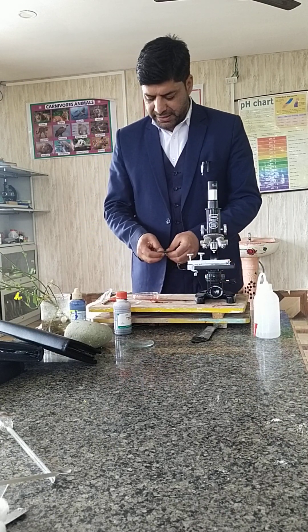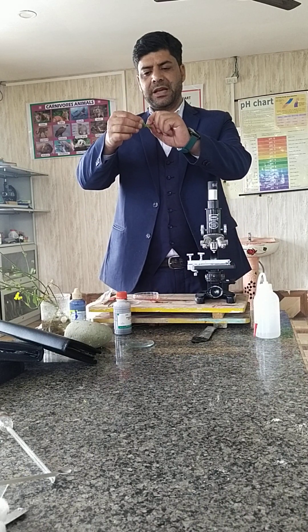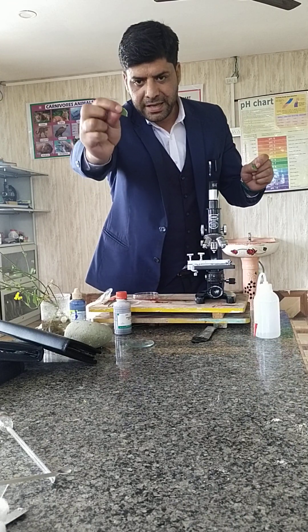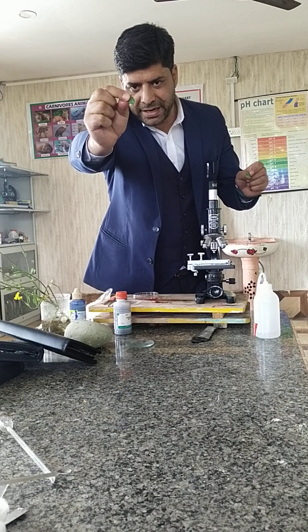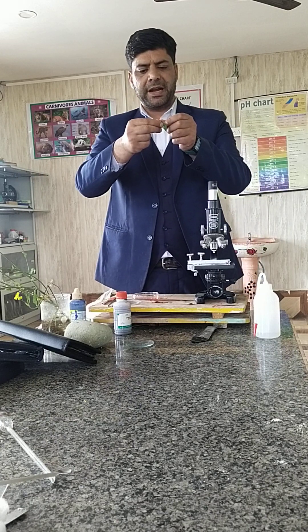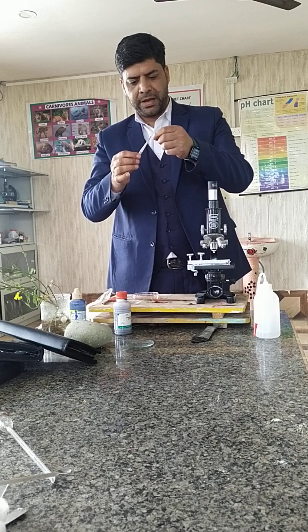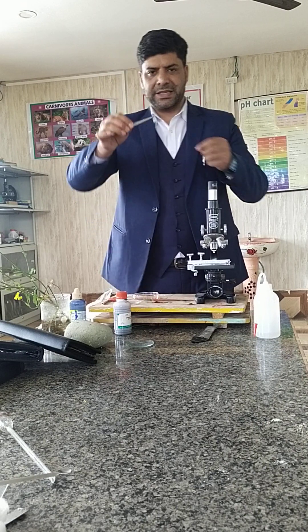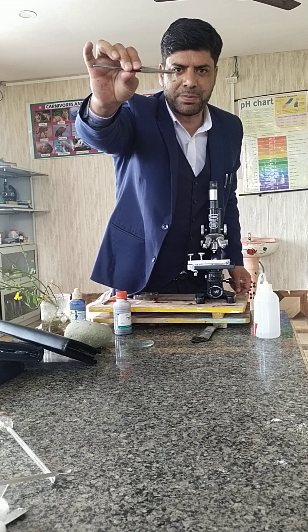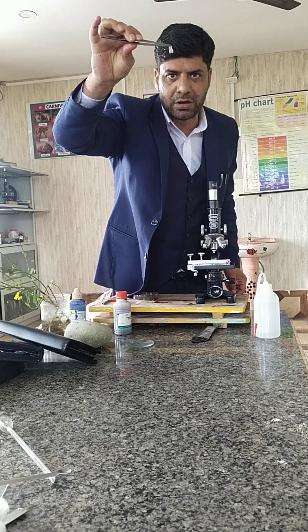You have to cut the leaf and you can see a transparent sheath here in the leaf. We have to cut a small fragment of it that we can observe under a high power microscope. As you can see, I have taken a sample — it is beautifully transparent.